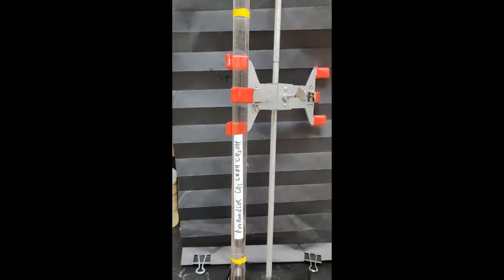So, okay, drop it in. Oh, well, that was very fast. So let's try again. Start, stop. So it just took a couple of seconds there. So we'll try another trial to make sure our results are consistent. Start, stop. Start, stop. So through the propane diol, it is a very quick transition.